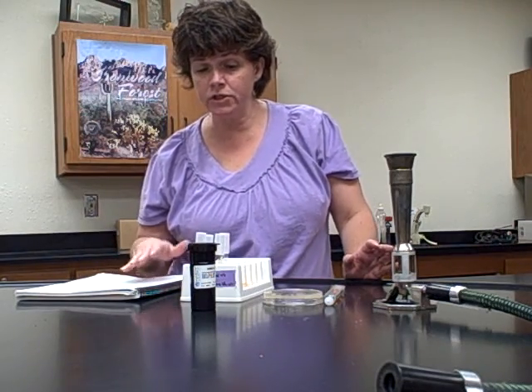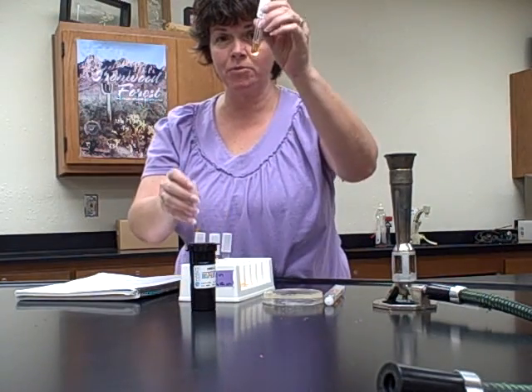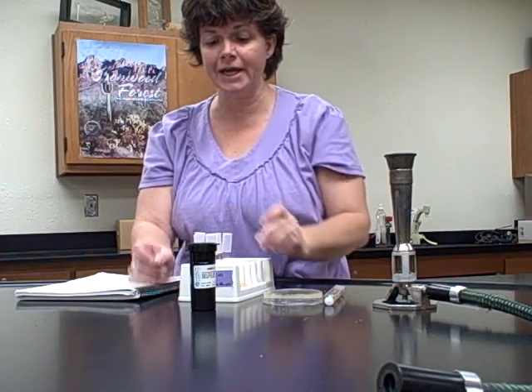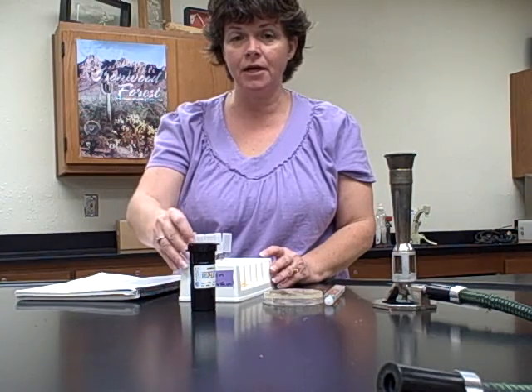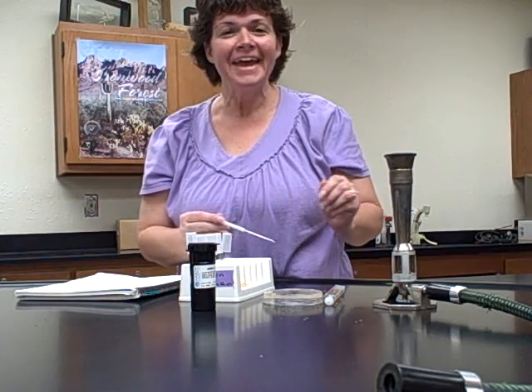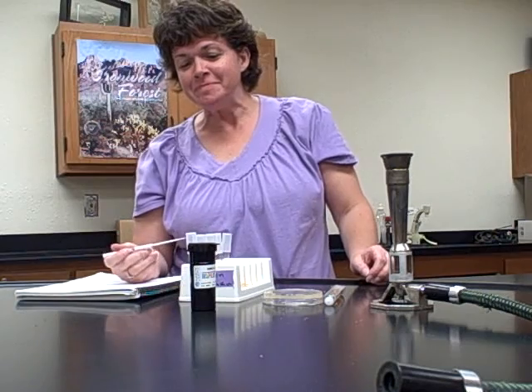Okay, so what you're going to do is inoculate those 4 tubes. So we have the MRVP broth, remember, one for MR, one for VP. If you recall, the Simmons citrate had that green agar, which is a slant. And then the indole is going to be a light color, just like the nutrient broth. And for those, you're going to use your inoculating loop, and you're going to inoculate those particular tubes.